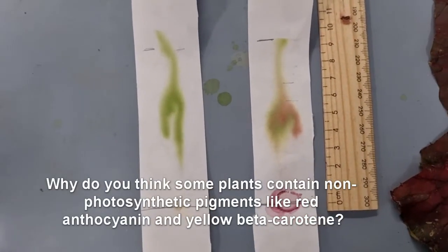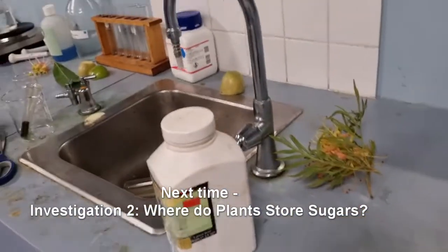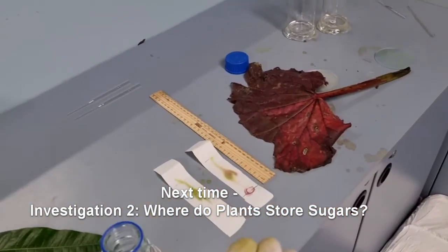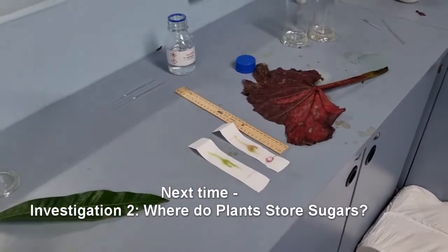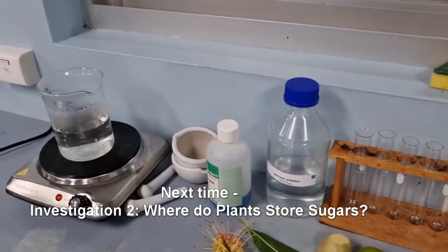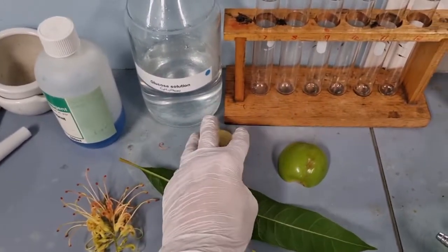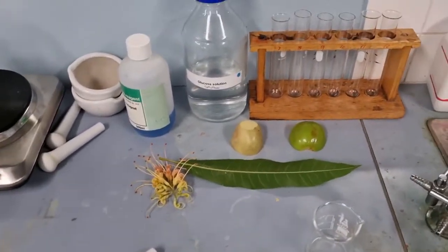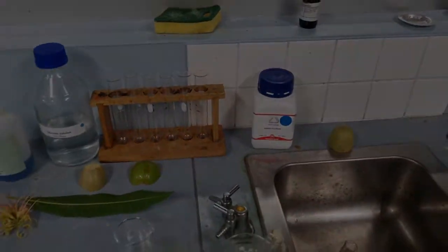But otherwise, we're going to move on to our next experiment now, which is looking at the presence of starch in different components of the plant. So chlorophyll is necessary for taking the energy from the sun and actually making photosynthesis occur so it can produce glucose. So we're going to do tests for the presence of glucose in different parts of plants. So flowers, for example, root systems, that's like a potato, you can just imagine that is part of the root. Fruits, leaves, and then we're also going to do those same tests on those items for starch. Okay, so let's start off with the starch.